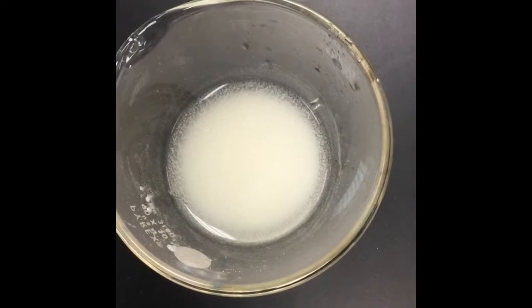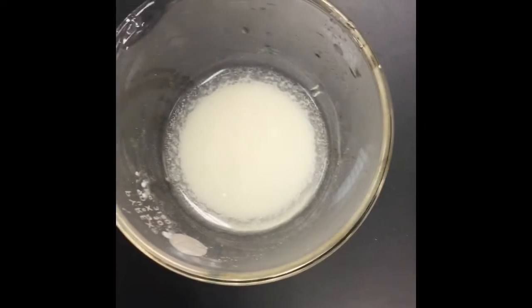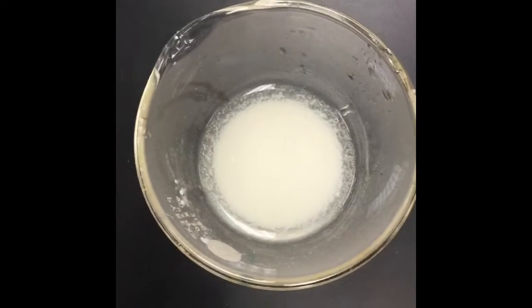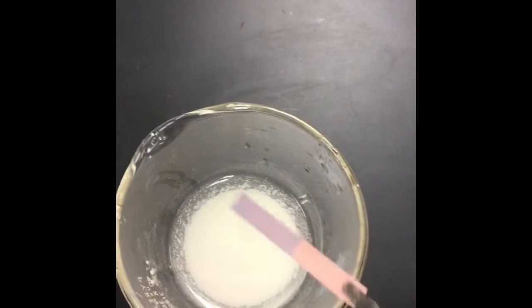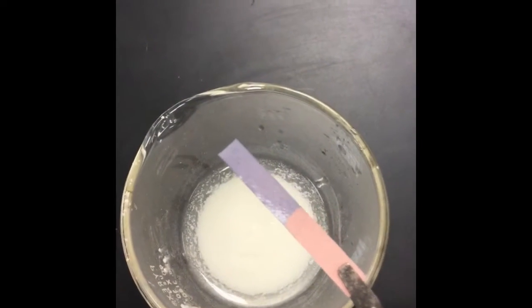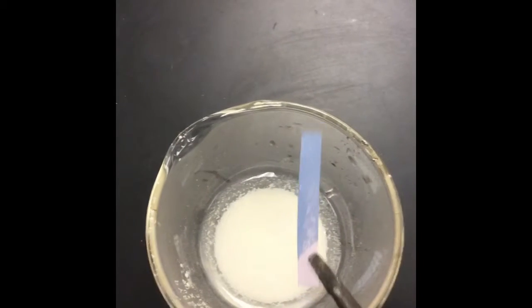So here's our calcium oxide sample again, but I added water. I wanted to test the water solution for the calcium oxide and see if in fact we have an acid or a base now. So here's my red litmus paper. Oh, and that turned blue. So that means that this was a positive test for a base. Let's try the blue litmus paper to see if it turns red.